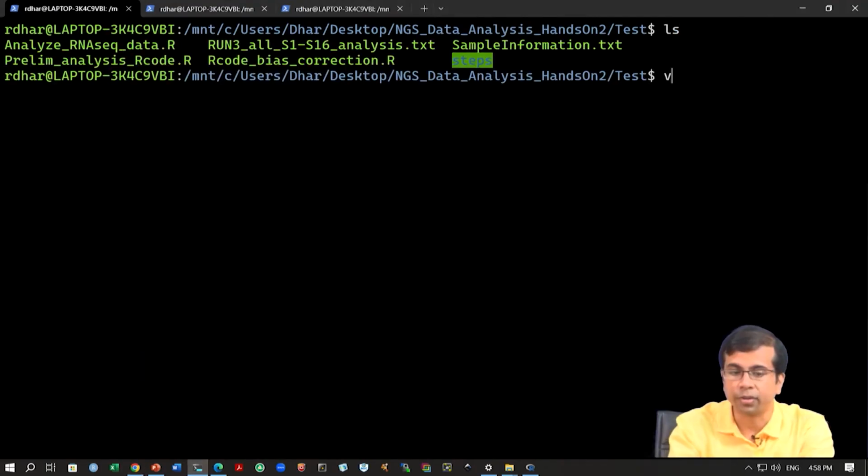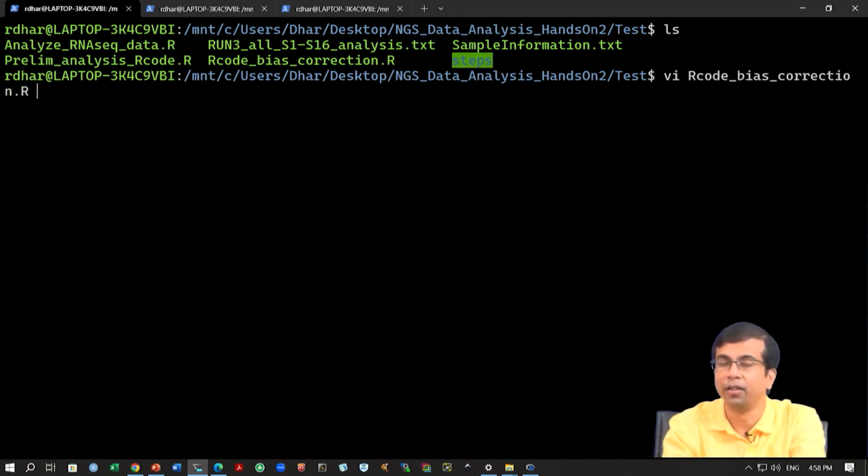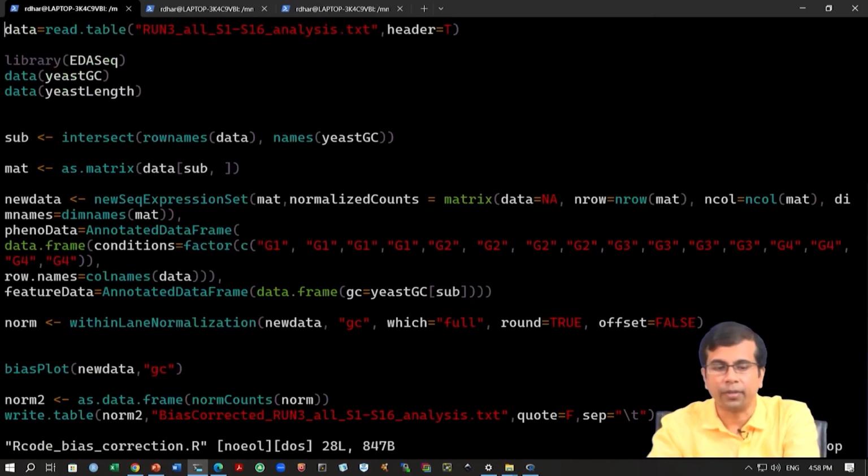Okay, so, let us move on to our data, okay, and then I have again prepared a set of codes that we can use. Okay, otherwise it will not be possible to complete this within this class. If you want to search the codes and then search the commands and set up everything, that might take quite a bit of time. Okay, so here it is, right.